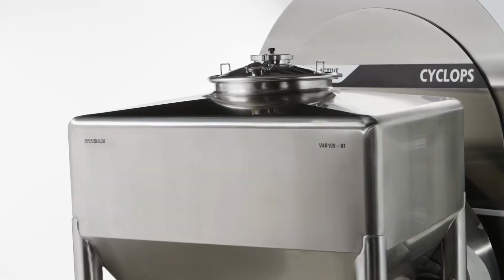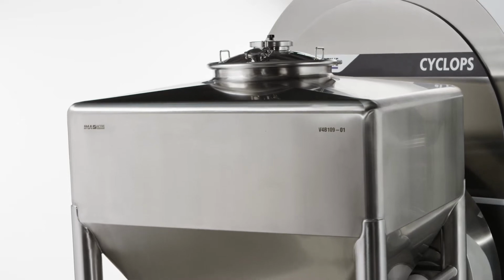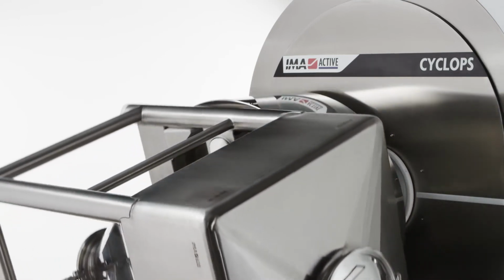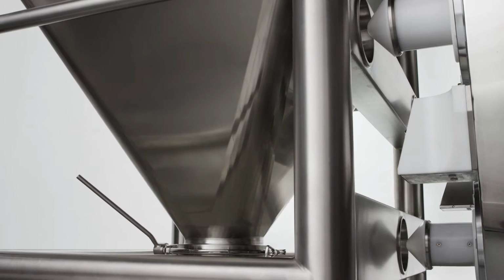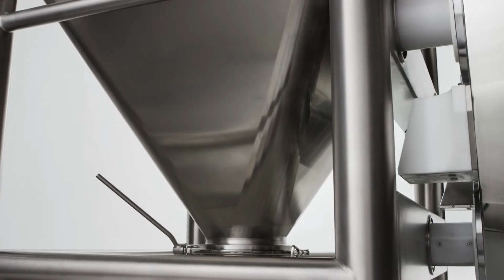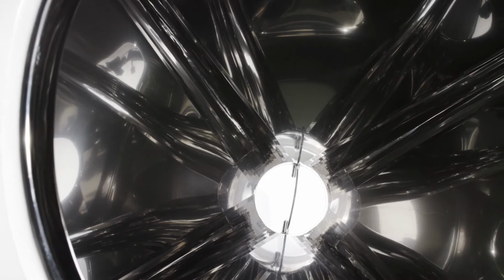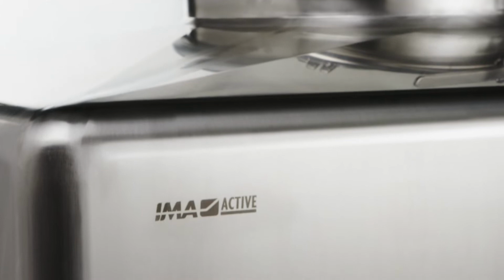The industrial size machine can be installed through the wall for top-level GMP configuration and space saving in the processing area, while the lab version, used for small batches and laboratory applications, is wheeled for easy moving inside the process room. The bin container geometry is proportional to the industrial bin, ensuring good scaling up.